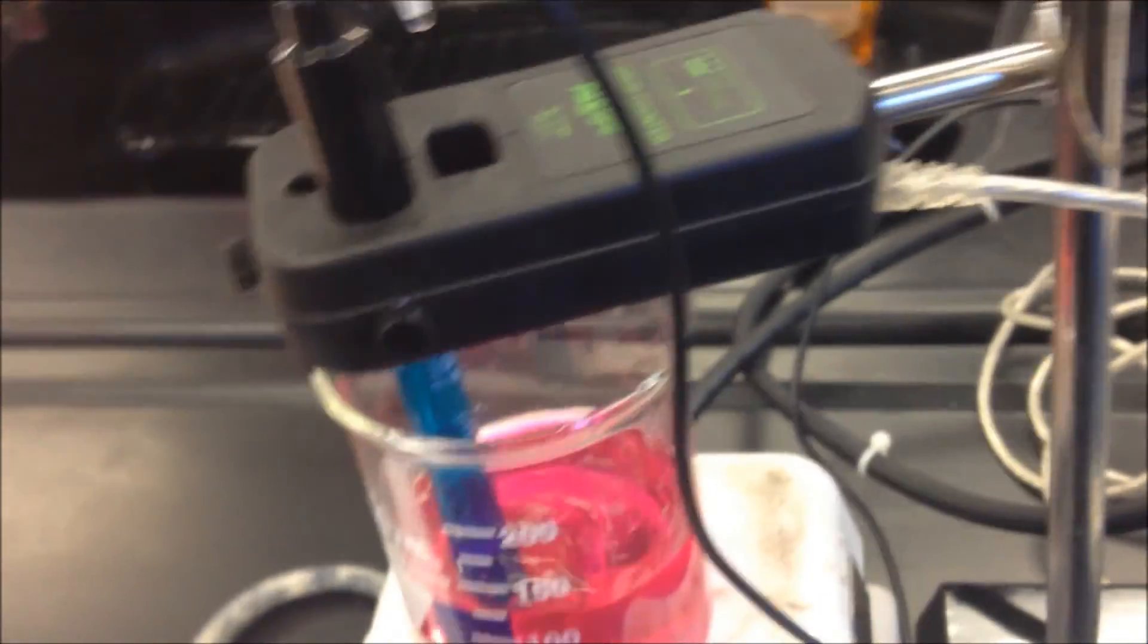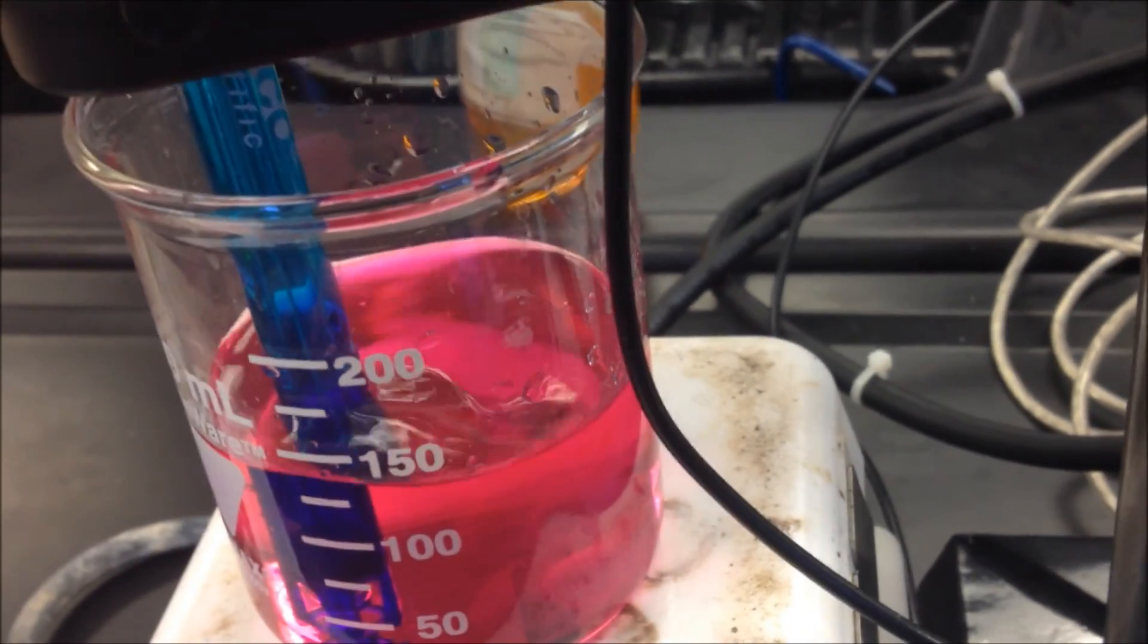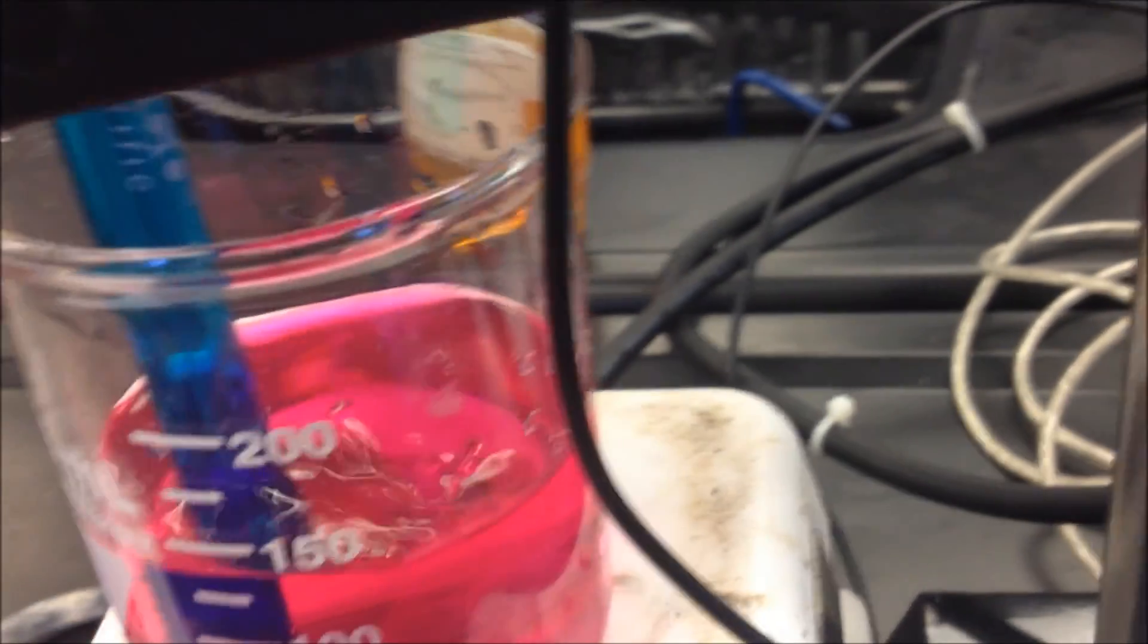High five. Well, we did something right. We ran out of stuff. We ran out of NaOH, so we're done.